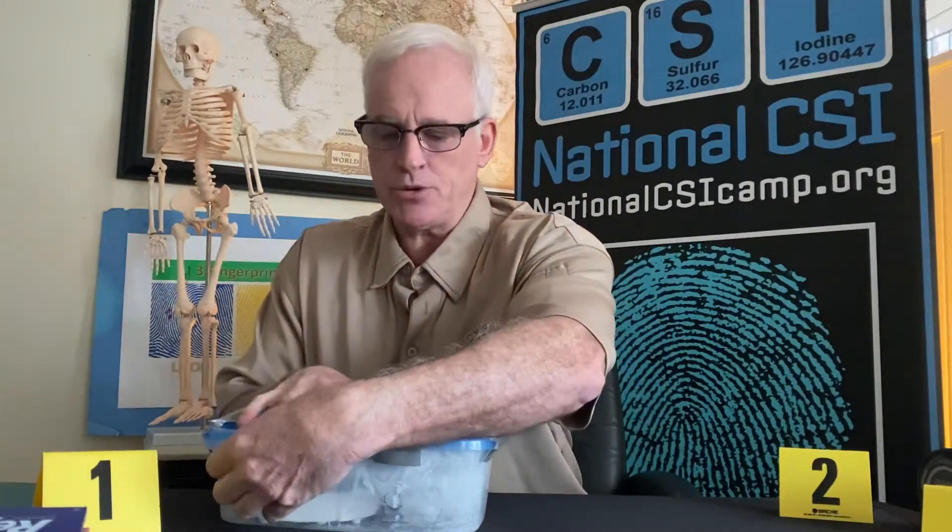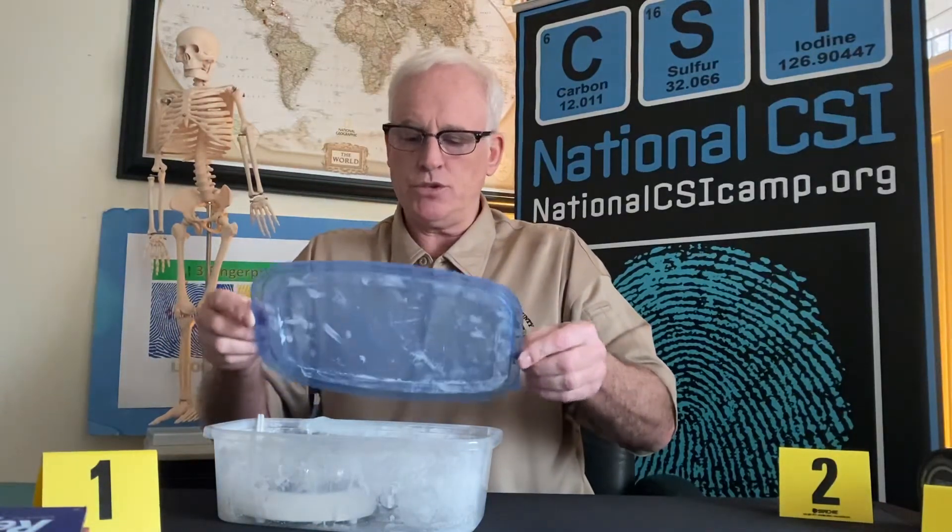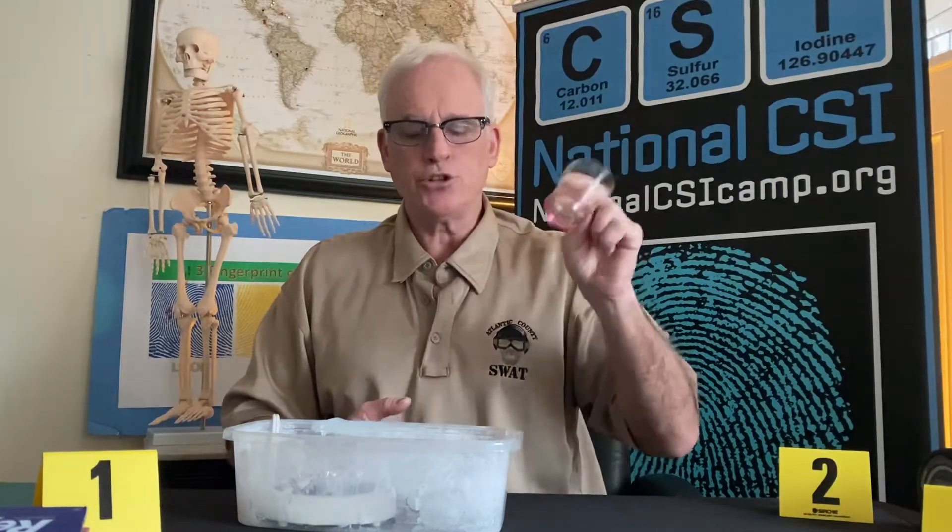After 15 or 20 minutes, have your parents help you carefully take the duct tape off. If you used a glass slide leaned up against the side wall of the Tupperware container, be careful when removing the tape so the slide doesn't drop. You don't want it to drop before the procedure is done because you want to get results. Have your parents burp the container a little bit — just take one corner, lift it up, and make sure those fumes are going out the window. It's very important not to breathe those fumes in.